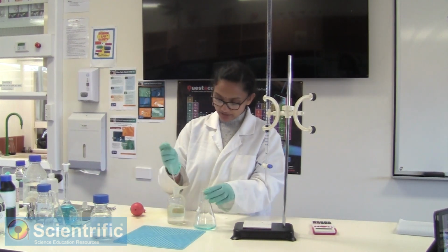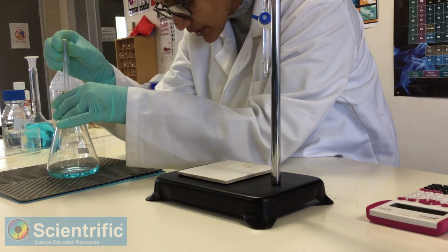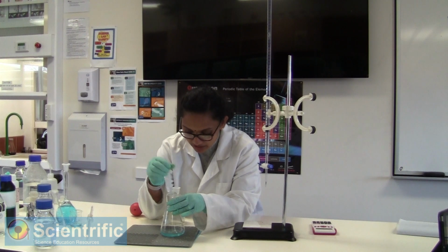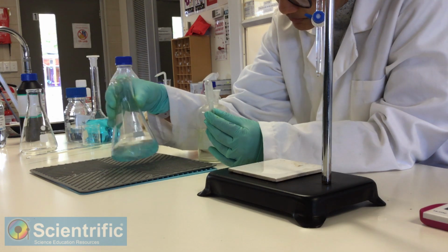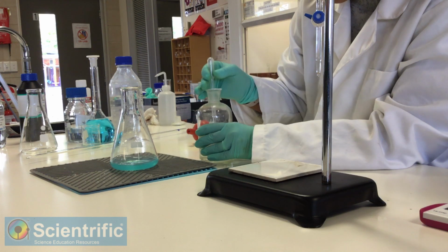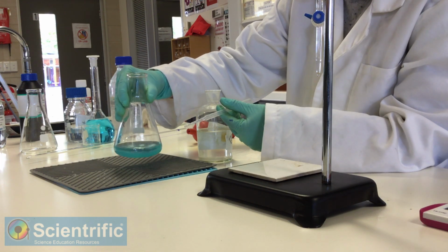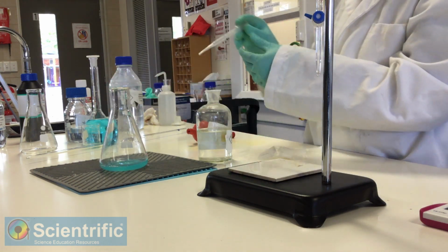So we take our sodium carbonate, we're going to see, as we add, we can see some precipitate formation, but we need that precipitate to stay for some time. It has become cloudy, and if I add a bit more, I can see that it still stays. It is not dissolving. So this tells me nitric acid has been almost neutralized.